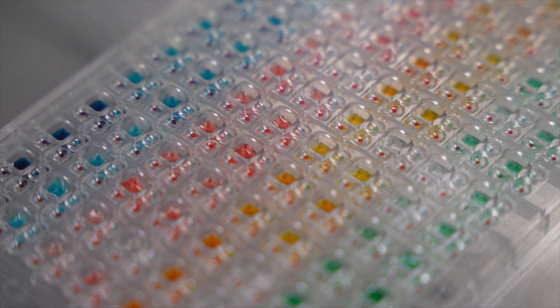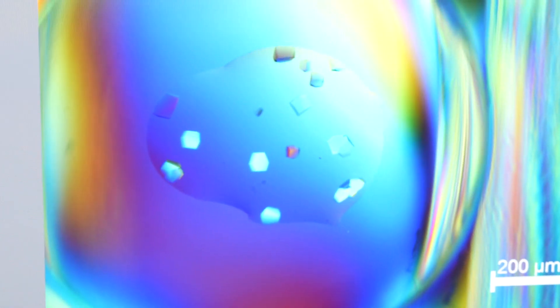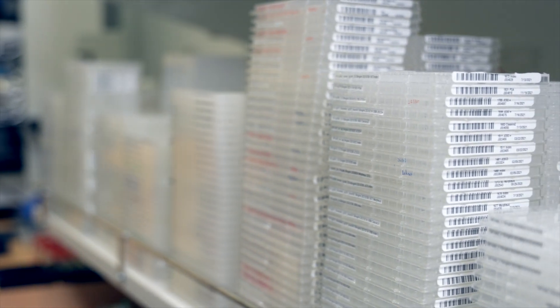Now that our tray is set up, we'll check it under a microscope for crystals. Sometimes a protein crystallizes right away, but if we don't find any crystals, that's okay. We'll let it sit on a shelf and we'll check it again tomorrow, and the next day, and the next day. It can take months.